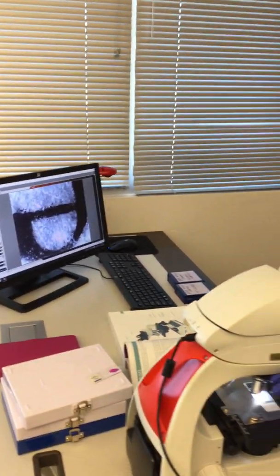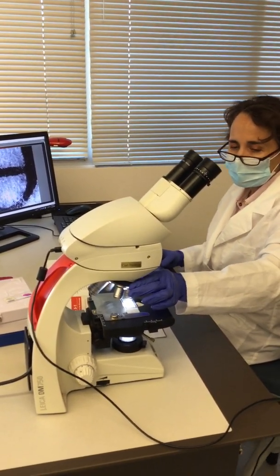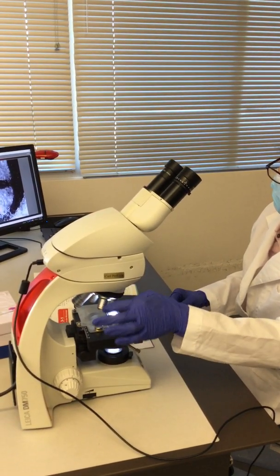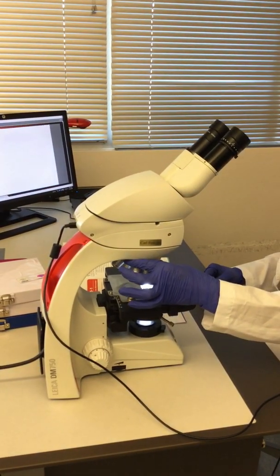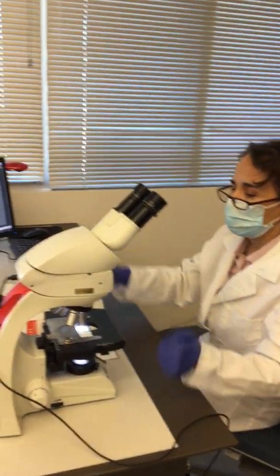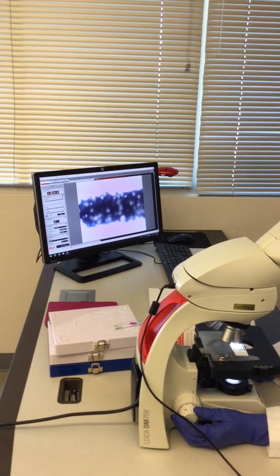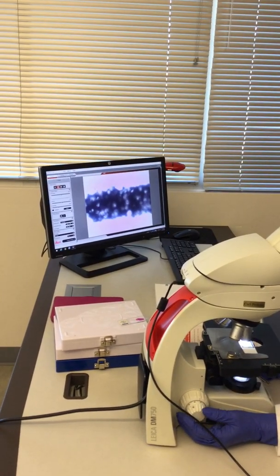And then I'm going to move, again grabbing your nose piece with the fingers in here, not directly the objective lens, and then you move to the high magnification, and at some point you see less. So that's your field of vision, and then you move the sample towards the middle, again using the parts that move the stage, and then again it's out of focus.